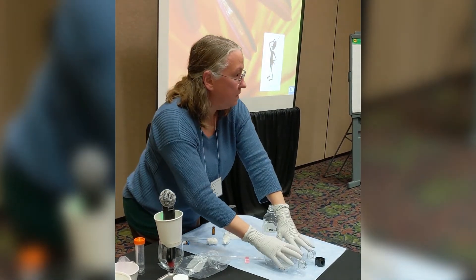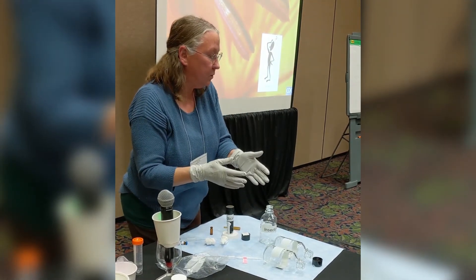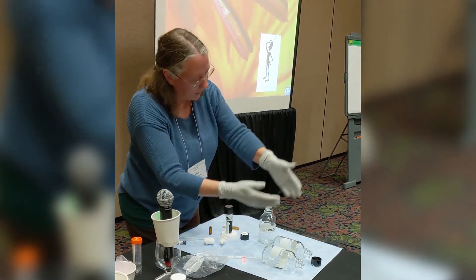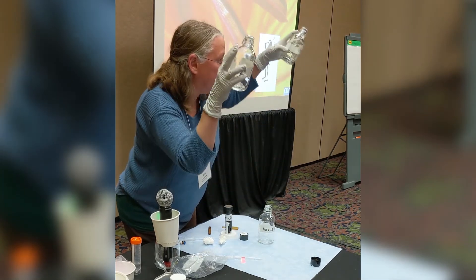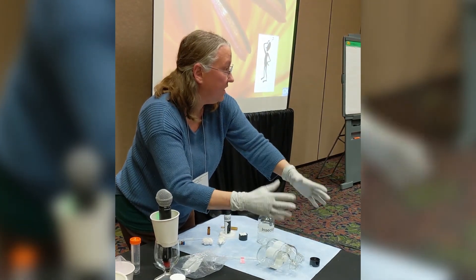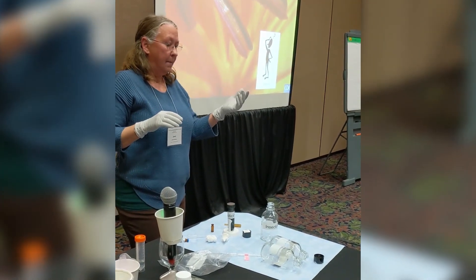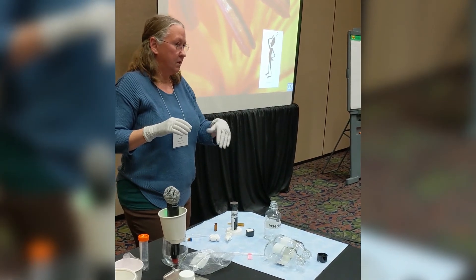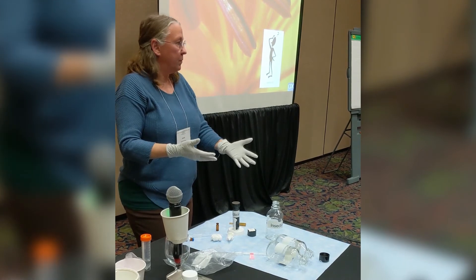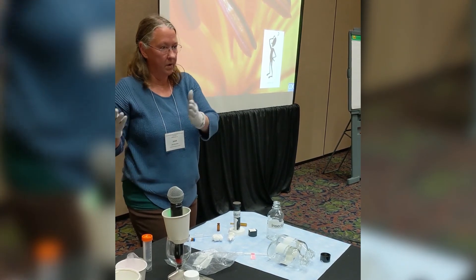You could make these in the morning and use them all day. Once you've run your mosquitoes through them and have another batch, you can take those mosquitoes out and put a new batch in to continue using the bottles. However, because there's lots of oxygen and light, some insecticides like naled will break down by the end of the day. So you really have to make naled bottles in the morning, use them as soon as possible, and you may only get about two runs before you need to make a new set.